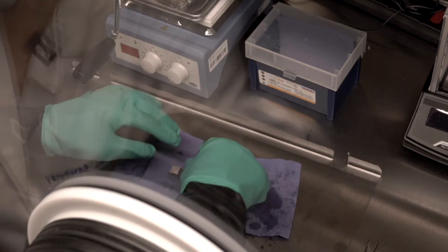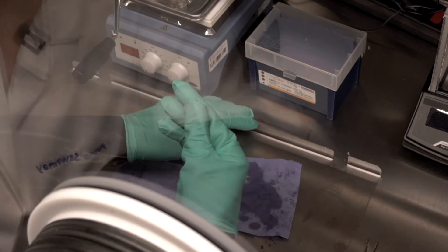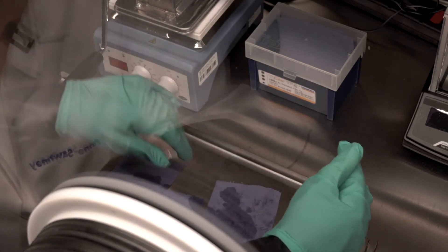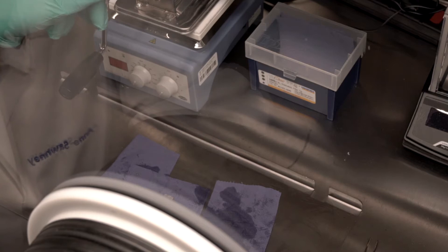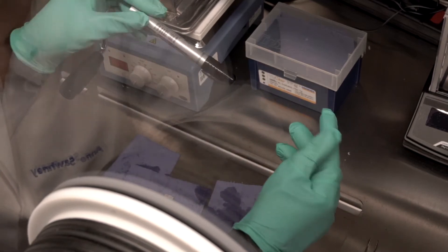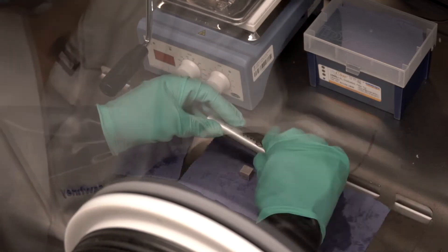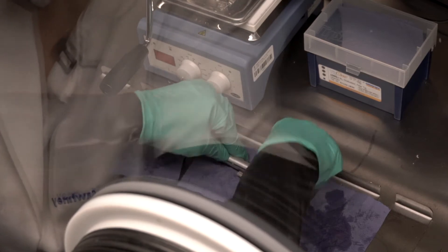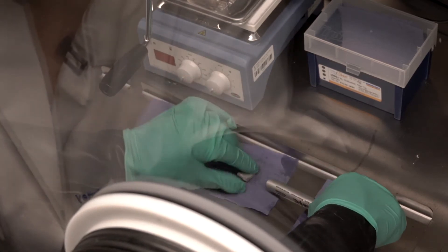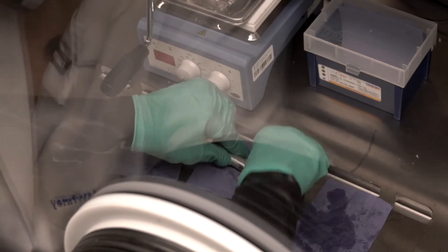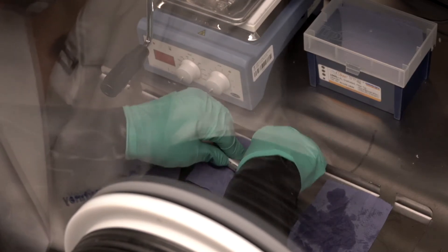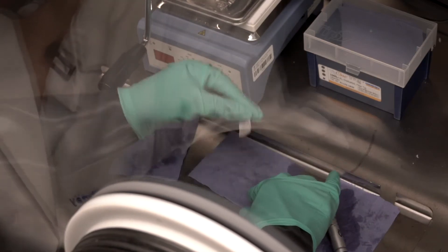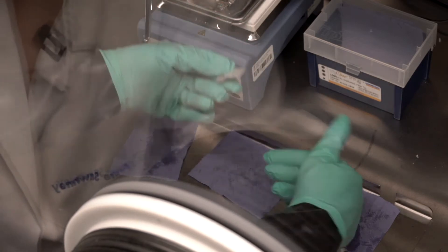The first step, because the cube itself won't yet fit into the pasta press, I do have to squish it down to fit between the rollers. Now, I use a marker for this. I really just need to squish it a bit. And you'll see, it's very soft, easy to press. That should fit as it is.